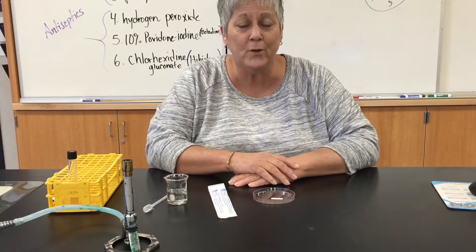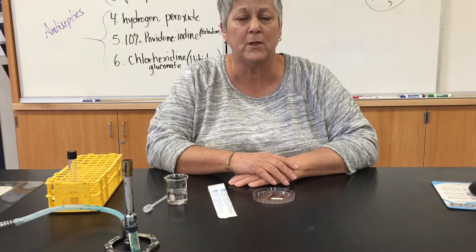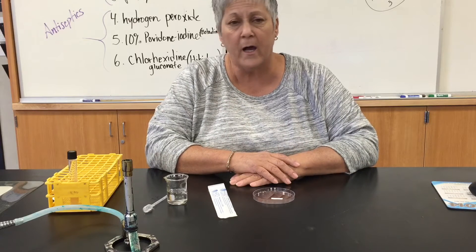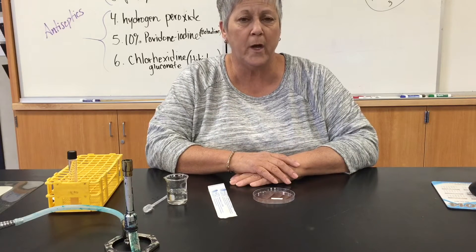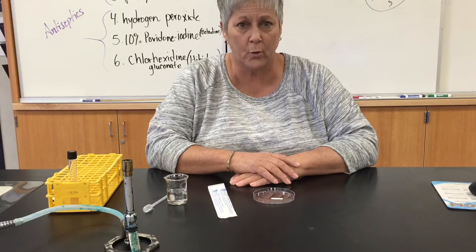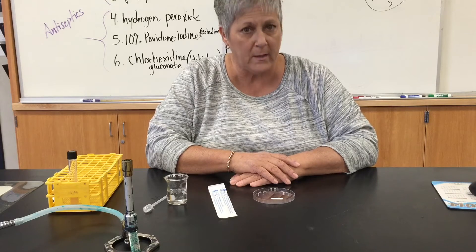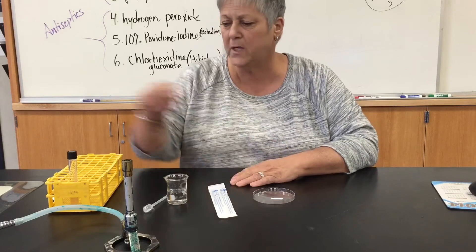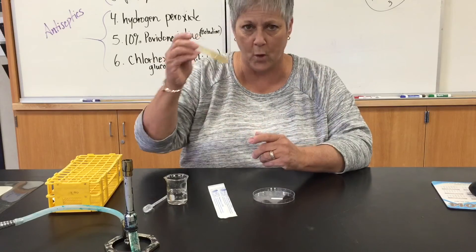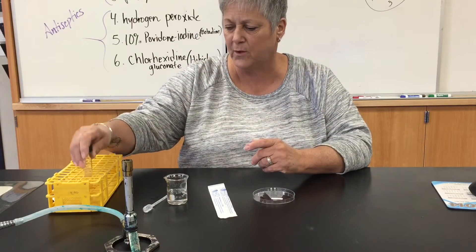I am not using any live organism for this demonstration, that's why I don't have a coat or gloves on, and I will insert a photograph at the end of the video showing you a positive reaction. But here's how you would do the test. This is just a TSA slant with no organism on it, just to use for this demo.